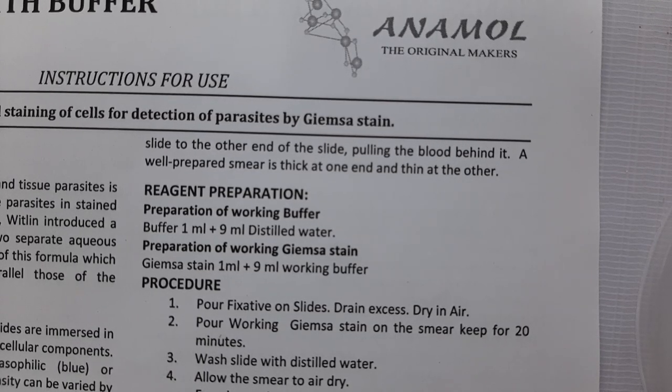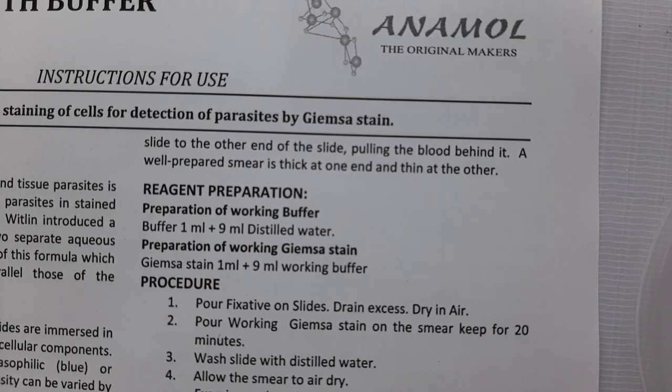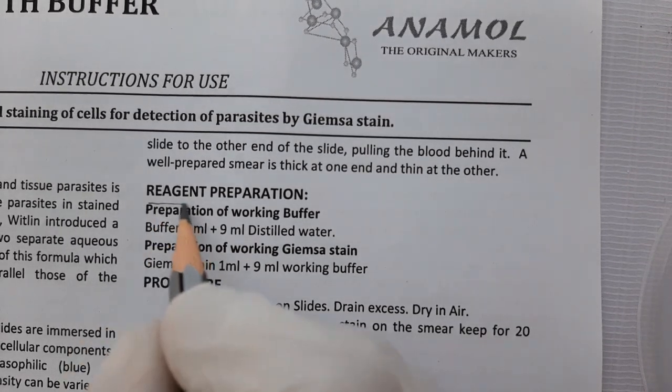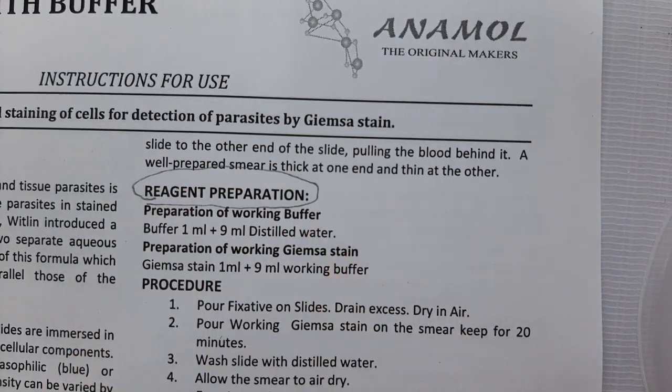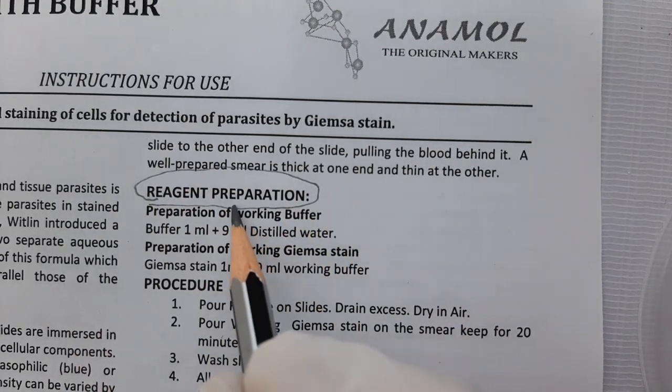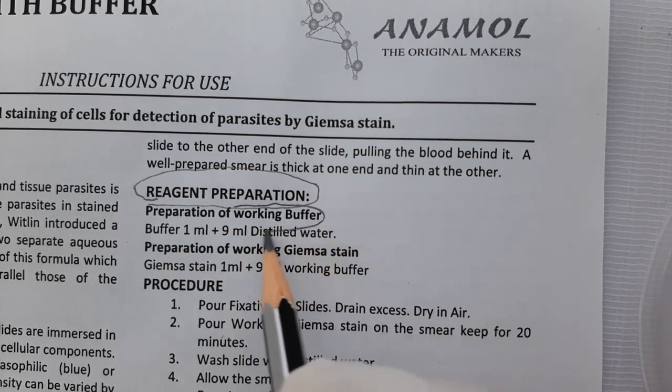Now, before going ahead, let's pay attention to the preparation of the reagent. In this kit, the reagent is prepared in two steps. In the first step, we need to prepare the working buffer.